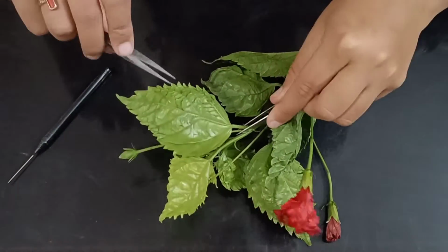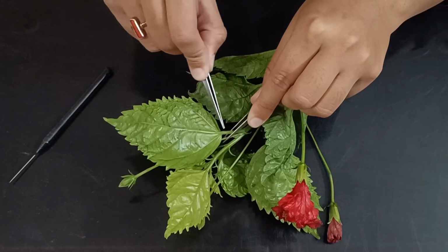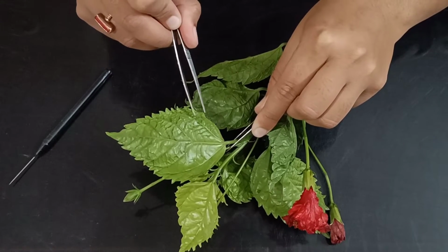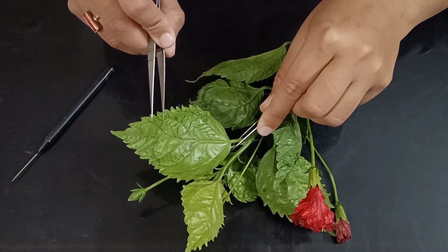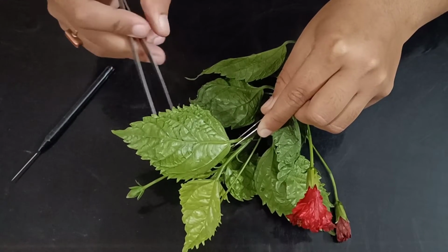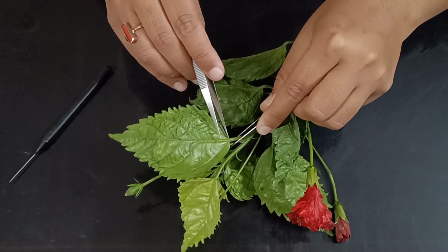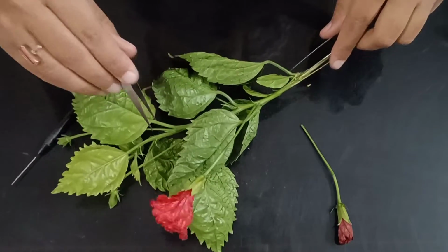So right now this is the leaf, you can see, right? This central rib is the midrib, right? And all these veins on the side, they are all reticulate venation, right? See, they are all tangled to one another, and they are not forming a specific network. So it is a very messy form of network. This is reticulate venation. In case of parallel venation, every vein would start from this point and end at the apex, right?